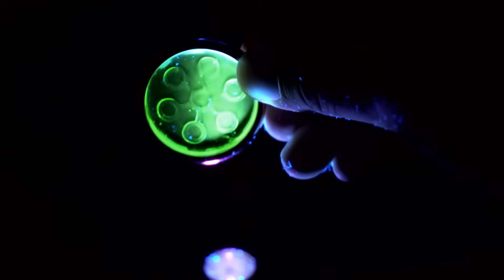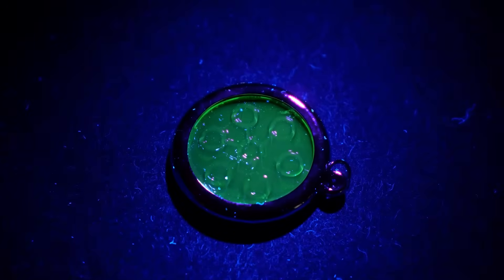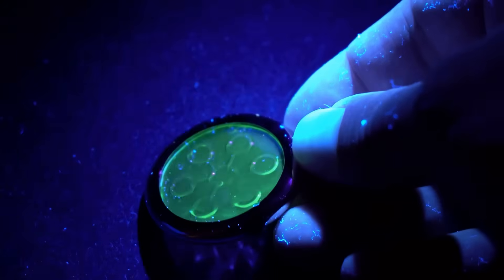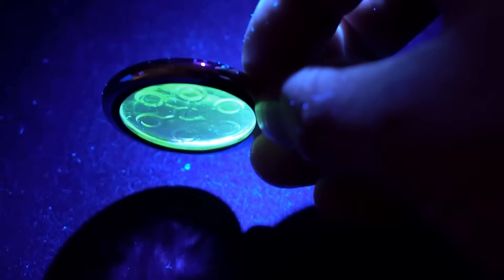However, they do have one interesting property, a bright luminescence under ultraviolet flashlight, which is very unusual for thorium compounds. After all, they usually do not glow under ultraviolet light. Perhaps in the composition of the glass, atoms of certain metals like thorium form ions that react more readily to ultraviolet radiation. Yes, it turns out that besides uranium dioxide, thorium dioxide can also be added to glass, which will start to glow beautifully green under ultraviolet light. The only problem is that, like uranium, thorium is radioactive and quite toxic. Therefore, the question remains open. There must be something else, non-radioactive and relatively safe.